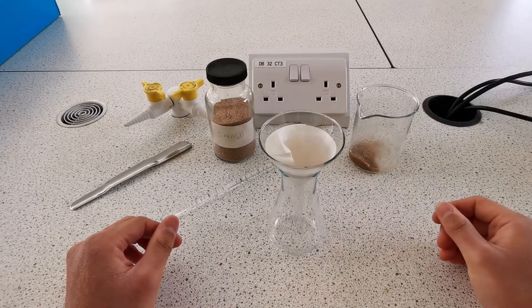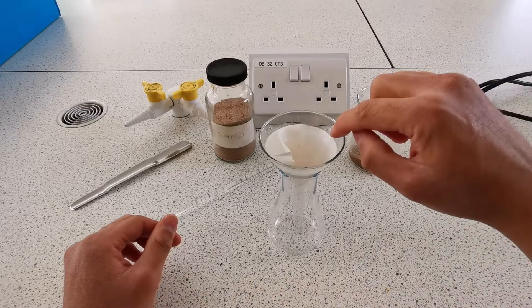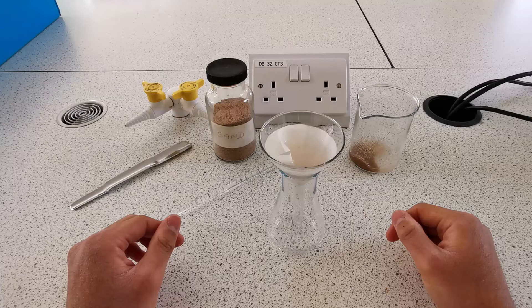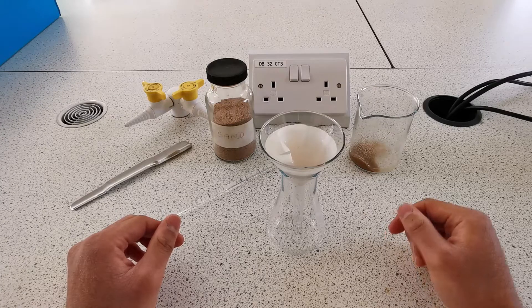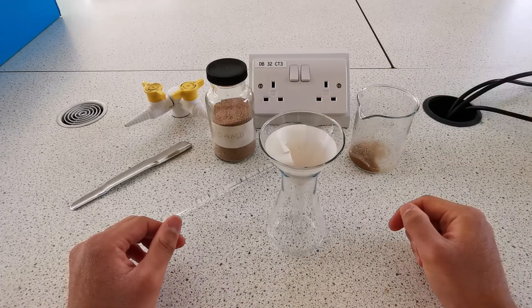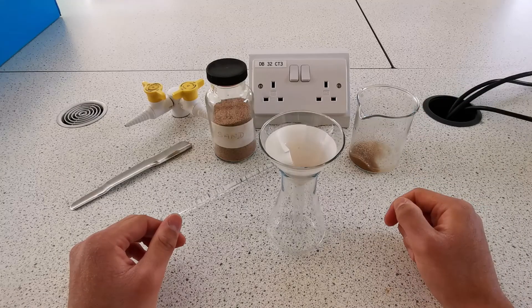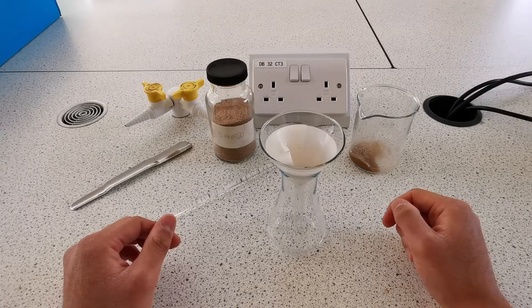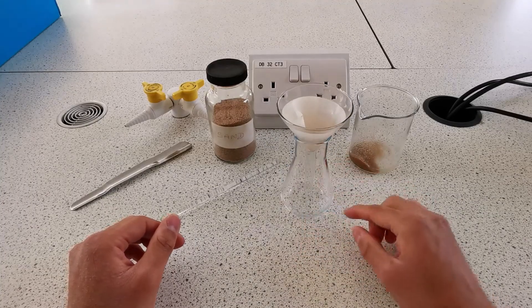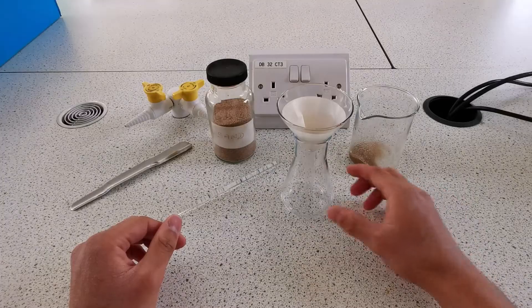We want to make sure that the substance does not go over the sides of the filter paper. The substance that stays in the filter paper is the residue — so the sand in this case is too big to pass through the holes in the filter paper, so it's the residue. The substance that is collected in the conical flask is the filtrate.